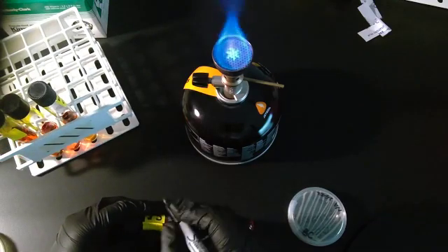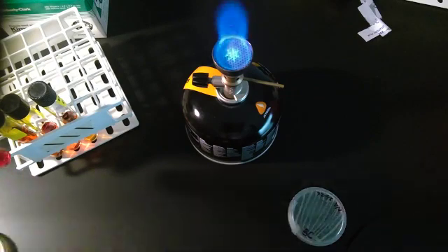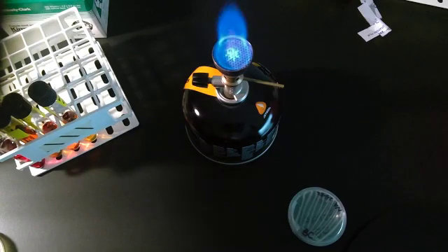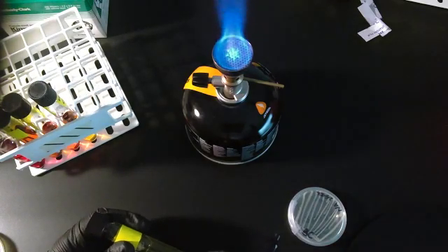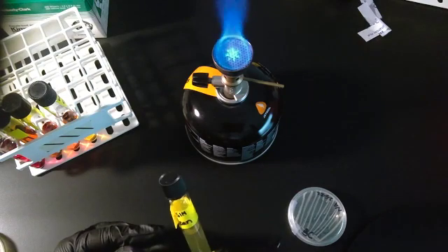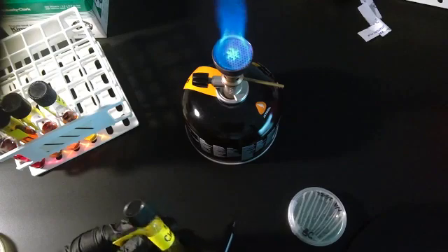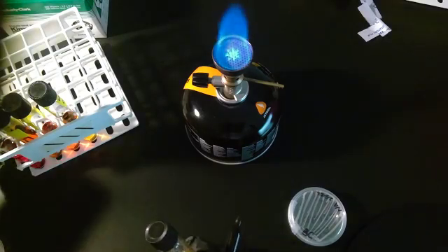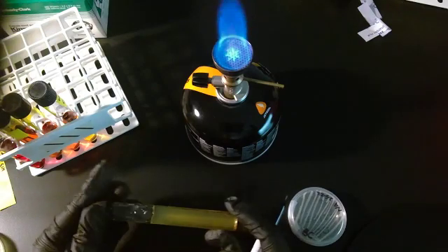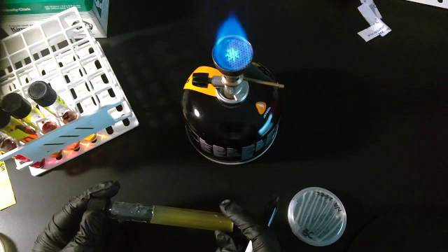With the phenol red tubes, it doesn't really matter if it's on the side of the tube because you're looking more for color than what the inside looks like as far as cloudiness. With the SIM tube though, it's going to be a bit different. I'm going to take this label off. I want to be able to see clearly the SIM and see through the SIM media.